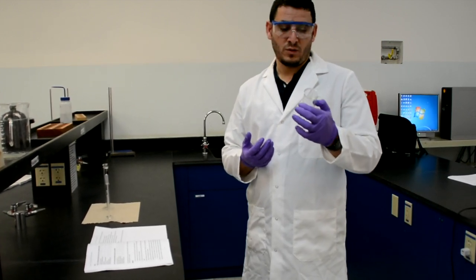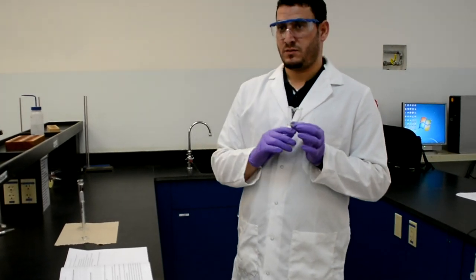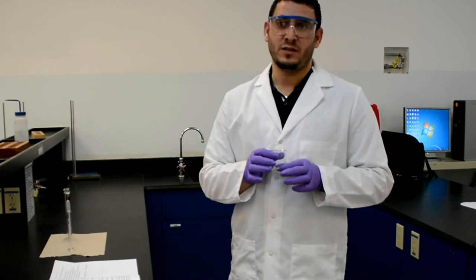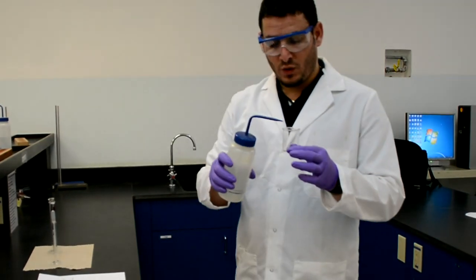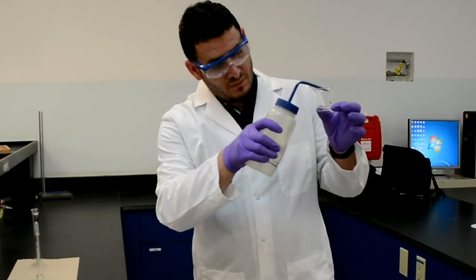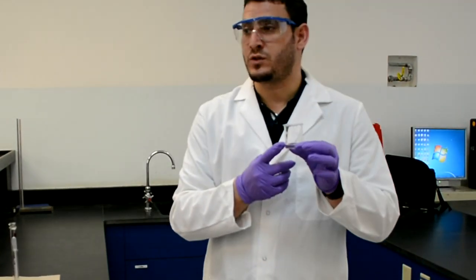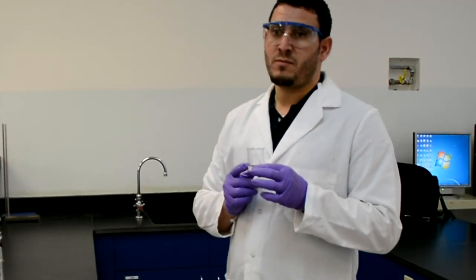What we will be doing is measuring a certain volume in a beaker. For example, you can measure 10 milliliters — that's the 10 mL mark here. You will be filling water to the 10 milliliter mark, and then you will measure the mass of that 10 milliliters. If I take water and fill until the 10 milliliter mark, I know I have 10 mL of water.